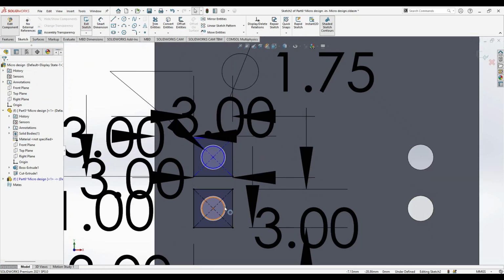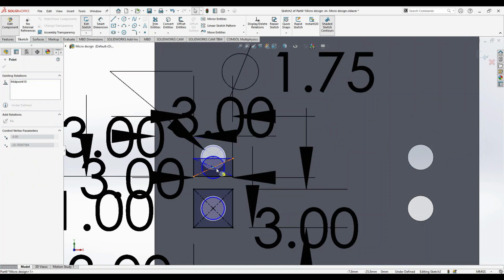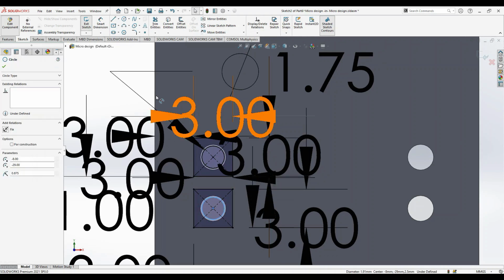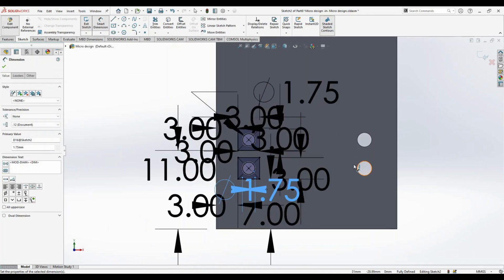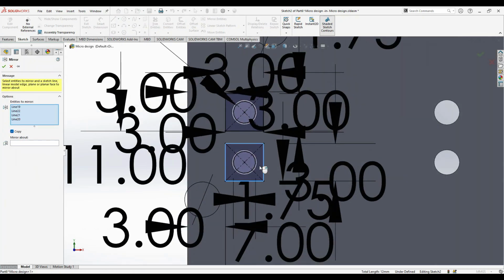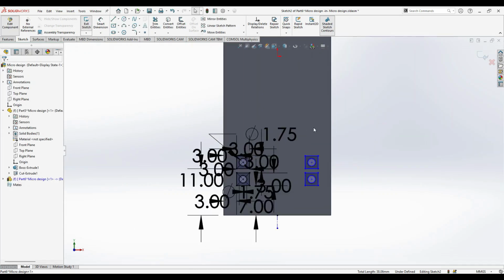Okay, here a few dimensions are deleted. It was by mistake. Okay, so the deleted constraint is this, and in this case the deleted constraint is the diameter. Instead of giving dimensions to this, what we can do is create a center line and mirror the complete entities. I can mirror this about this line. Since they are symmetric, you can see this.